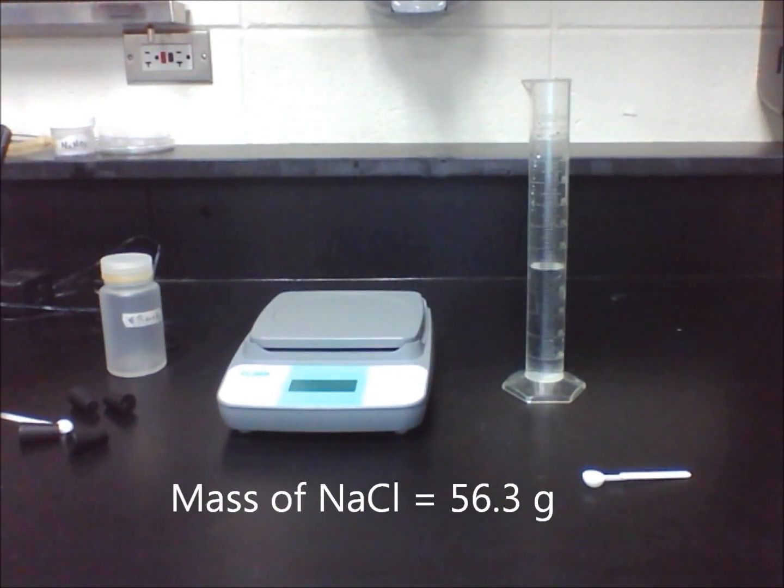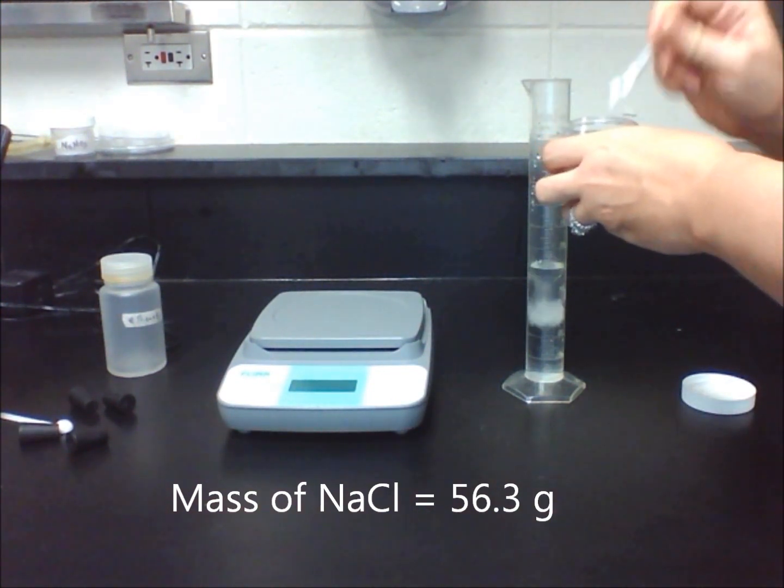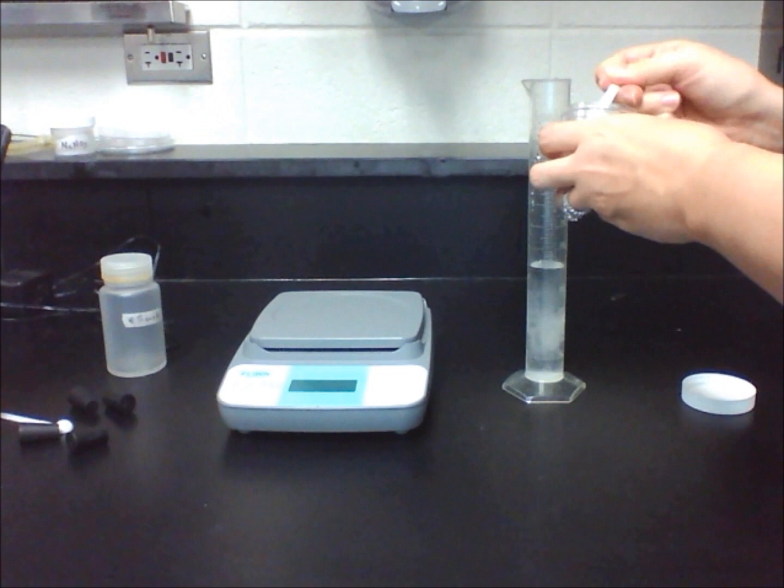Place five scoops of salt into your graduated cylinder with water and gently swirl so the salt can dissolve, but be careful not to spill any of the materials.